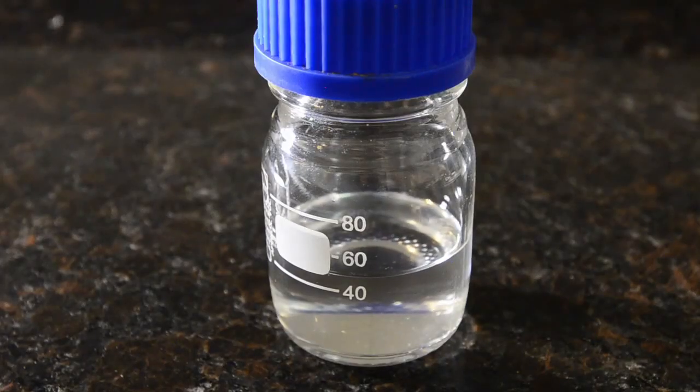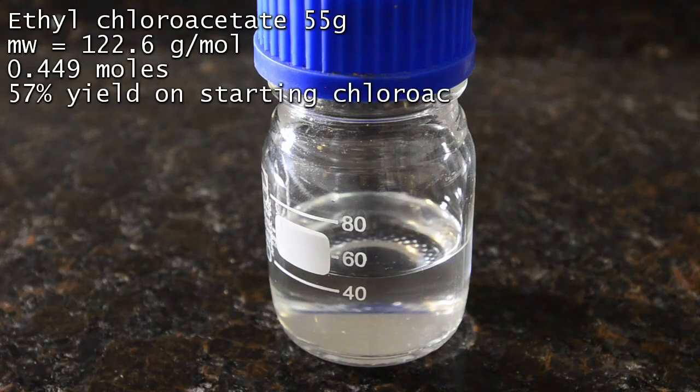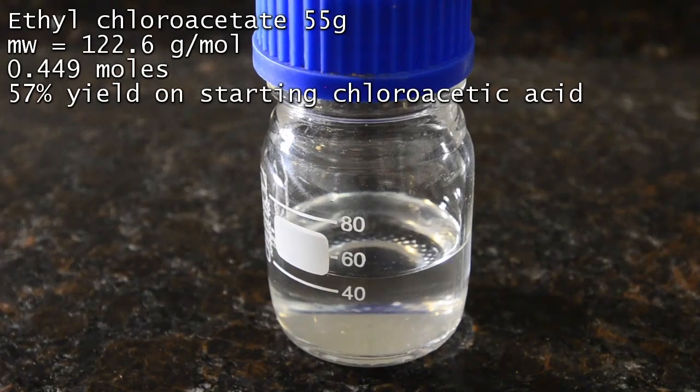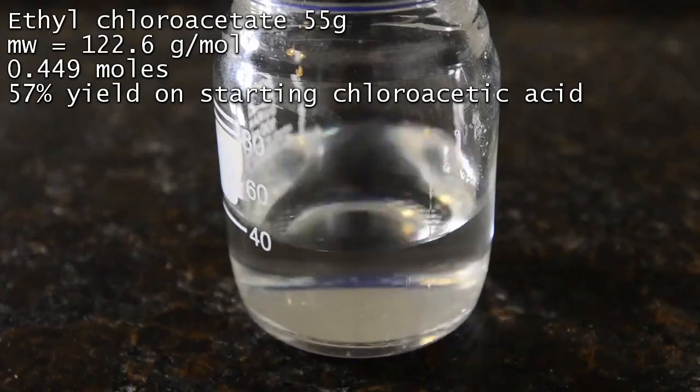Here's our product: 55 grams of ethyl chloroacetate. We were interested to see how much we'd get, but despite our attempts at drying and recycling ethanol, this is only a 57% yield on starting chloroacetic acid. But this is not bad considering how much we messed around with the reaction.